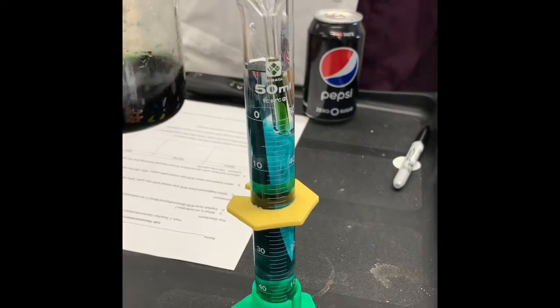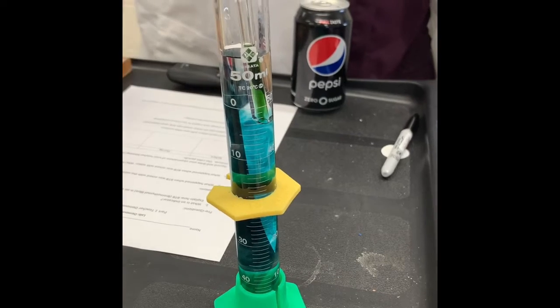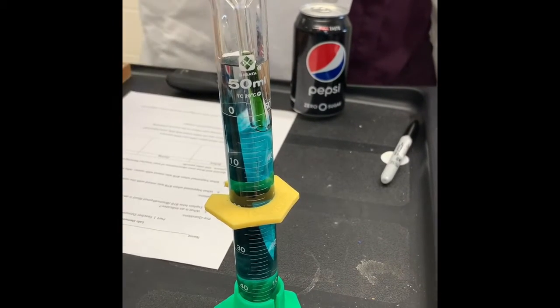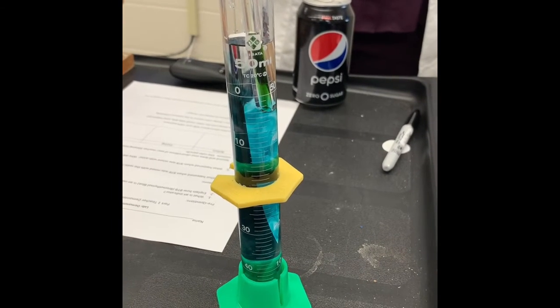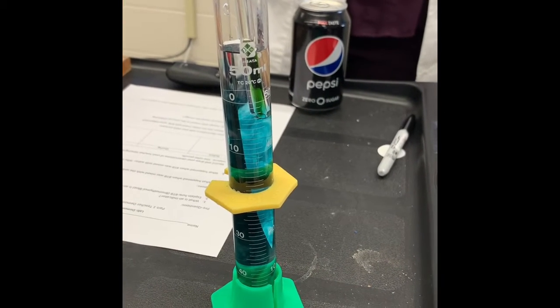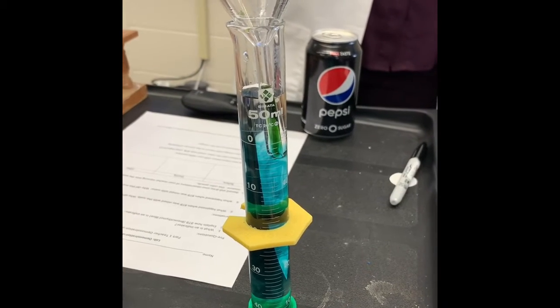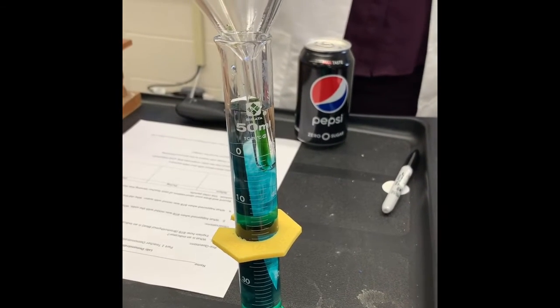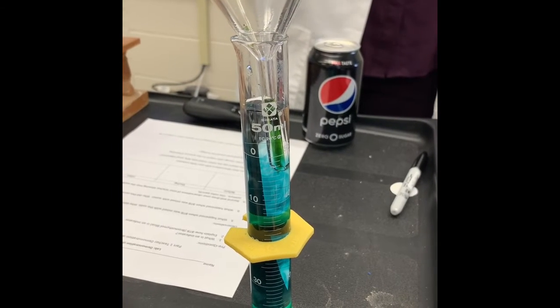So let's talk about what happened. Write down for your response what happened. And I think we'll agree it stayed the same color. And why? Why didn't it change to another color? Somebody tell me, why do they think that this stayed the same color? This is water. We agree that water is neutral. It's a 7 on the pH scale. Why didn't this change colors?